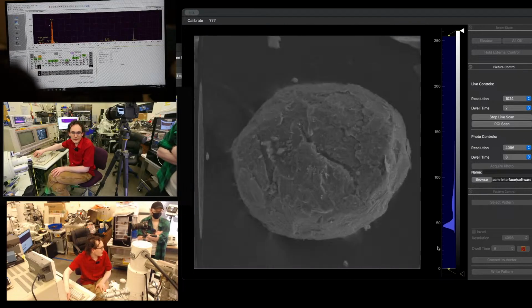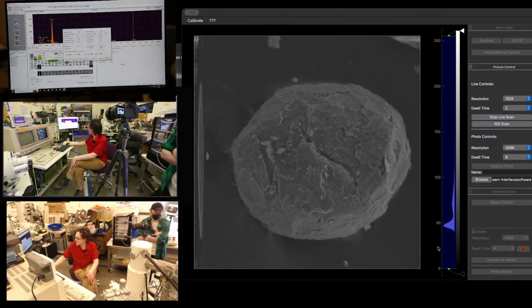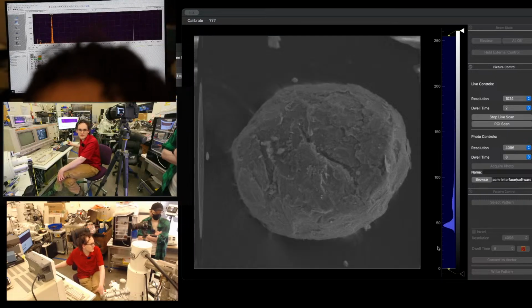So yeah, that's what we found. A lot of little chunks of aluminum. And I'm going to look at this a little bit more closely when I get some more time to capture some images and do some analysis, but yeah.